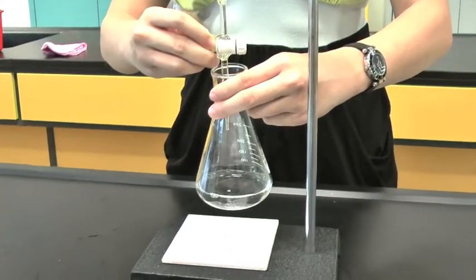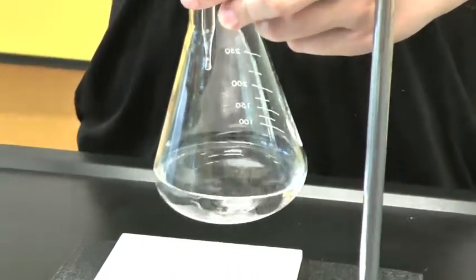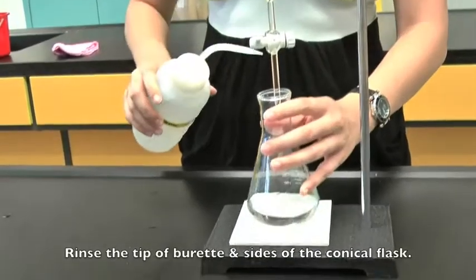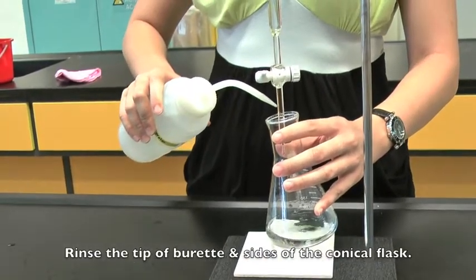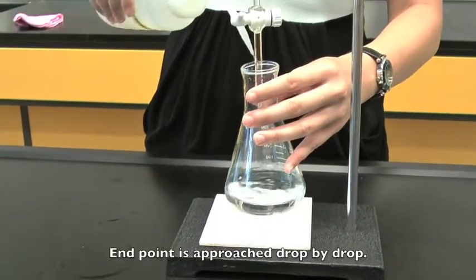The end point should be approached slowly, drop by drop. When the end point is almost reached, rinse the tip of the burette and sides of the flask with distilled water.